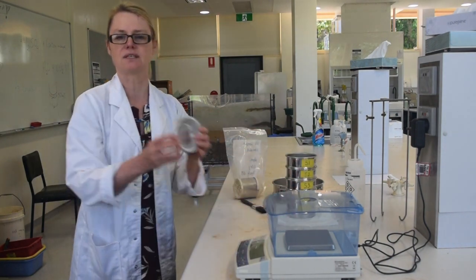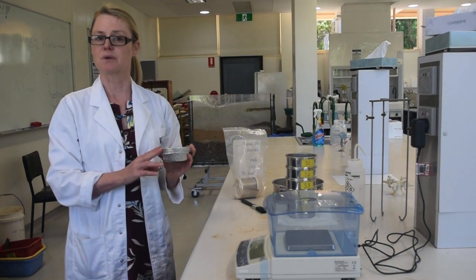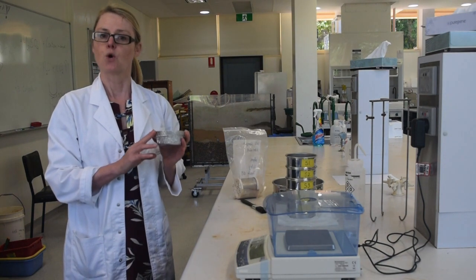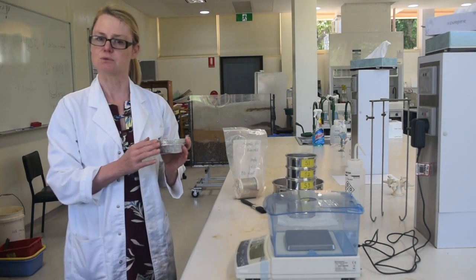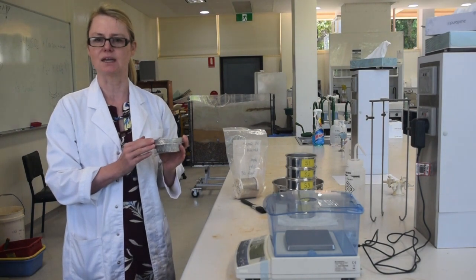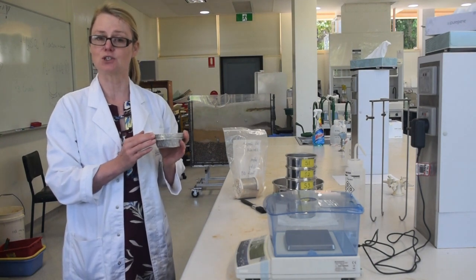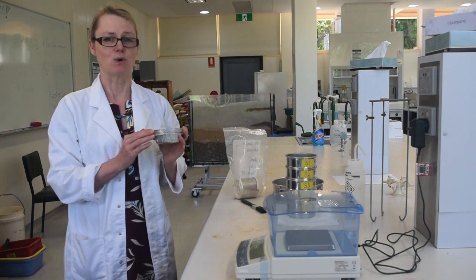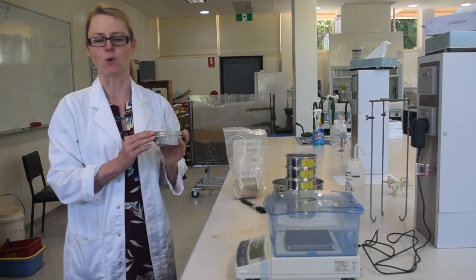You'll also be using various aluminium tin trays — there are these sizes here, but you might also be provided with some larger sizes as well. When you're using these tin trays to collect samples that you need to subsequently dry in the drying ovens, please be sure to label them correctly before you put them in. This is because you'll need to re-weigh them the following week, and other people use these drying ovens, so we want to make sure you can find your samples the following week.